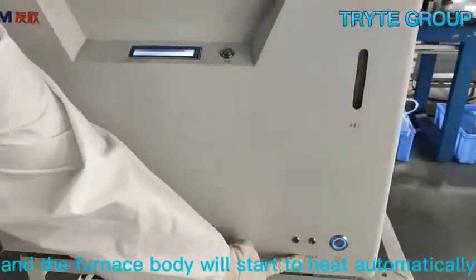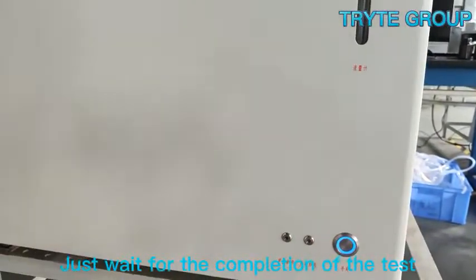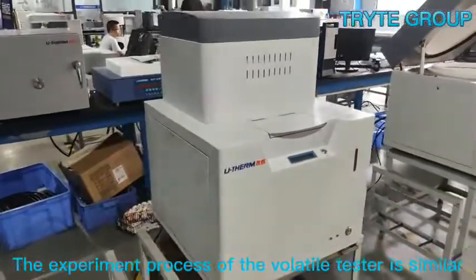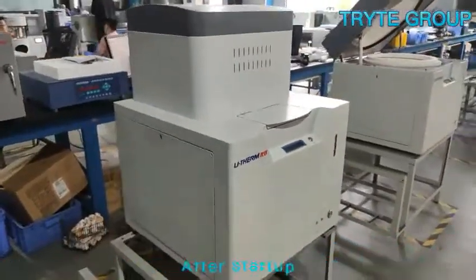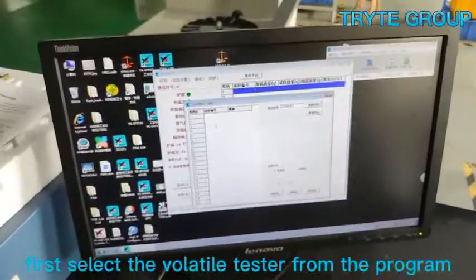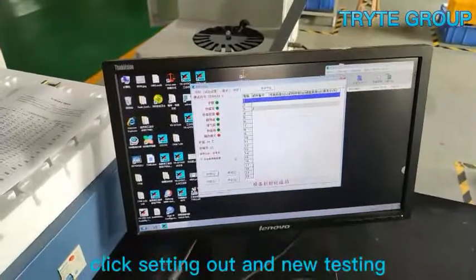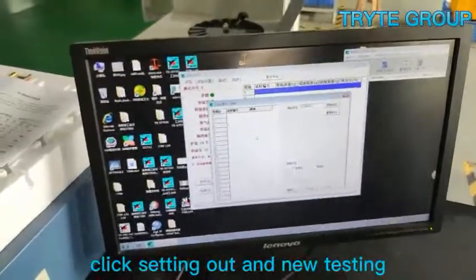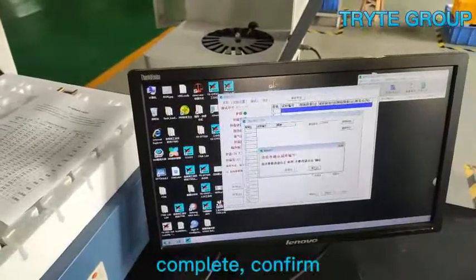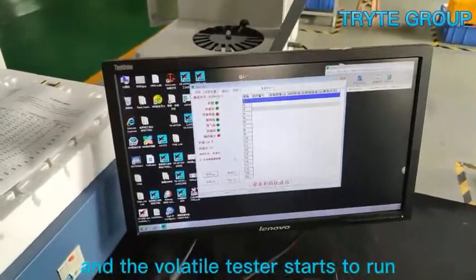The heating indicator light will turn on and the furnace body will start to heat automatically — just wait for the completion of the test. The experiment process of the volatile tester is similar. After startup, first select the volatile tester from the program, select automatic weighing, click setting out and new testing.